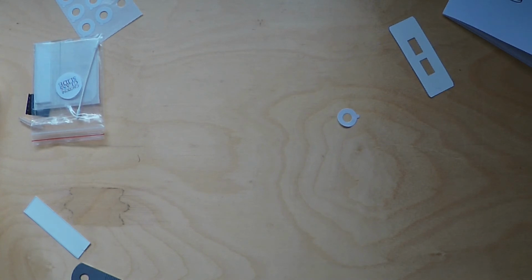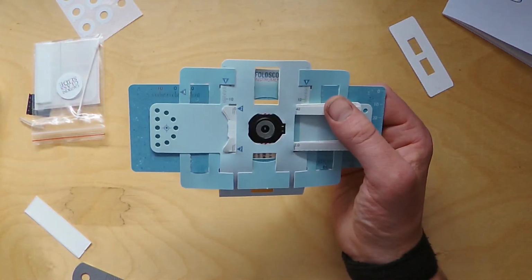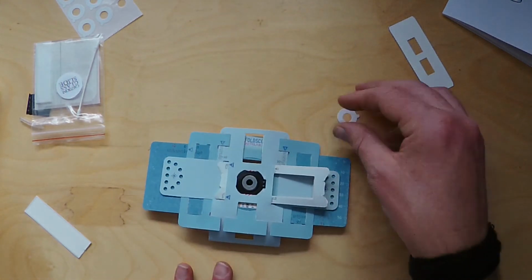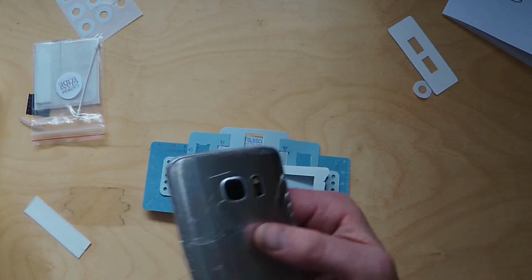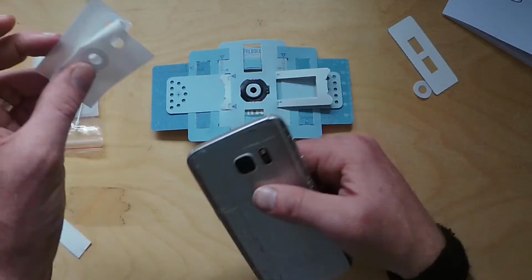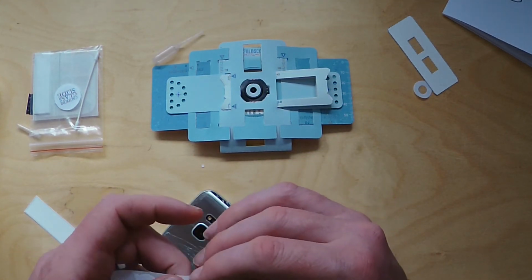Yeah, so you can't really see it here, but I've just successfully found the sample. I don't think it'll show on this camera, but what I will do is show you very quickly how to use your phone with the Foldscope. Okay, so people may have much better phones than mine, but the basic idea is that we find our stickers again that we use to stick the lens. Take them off.